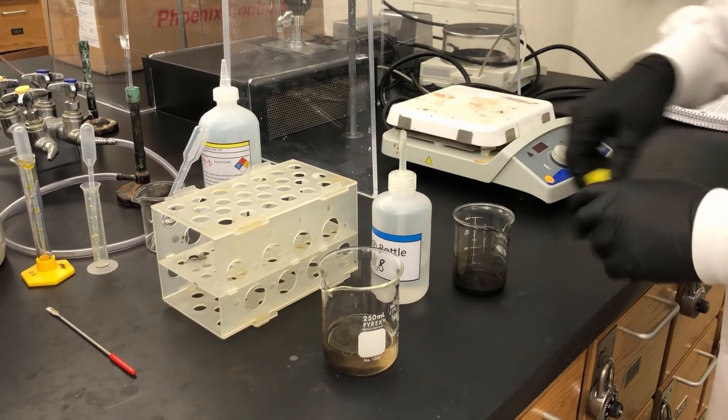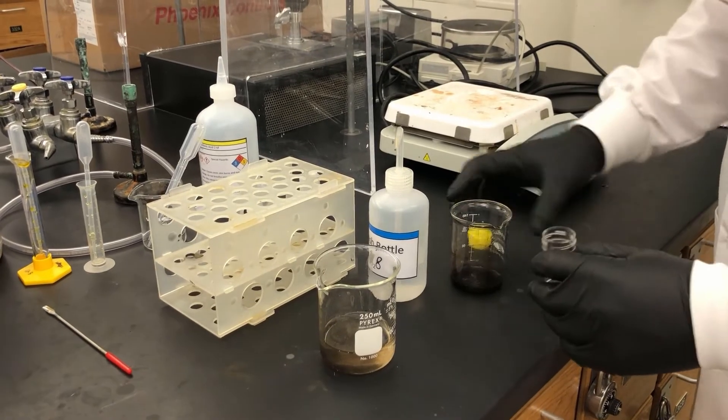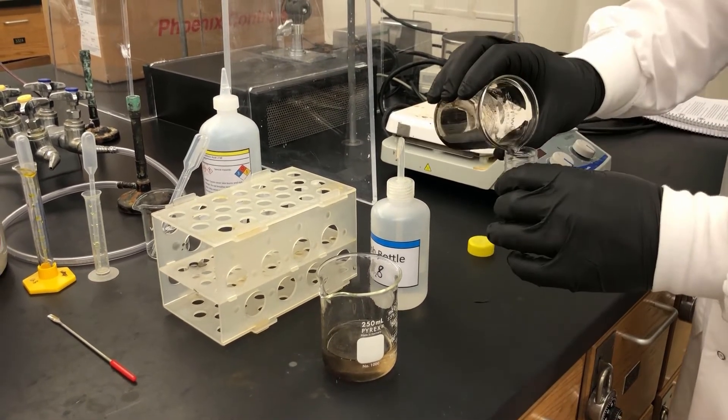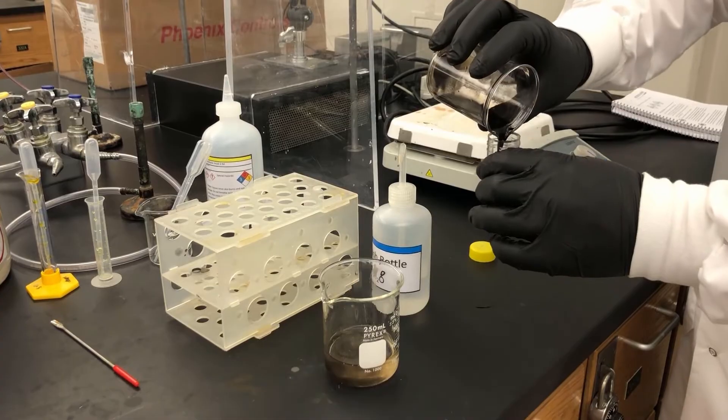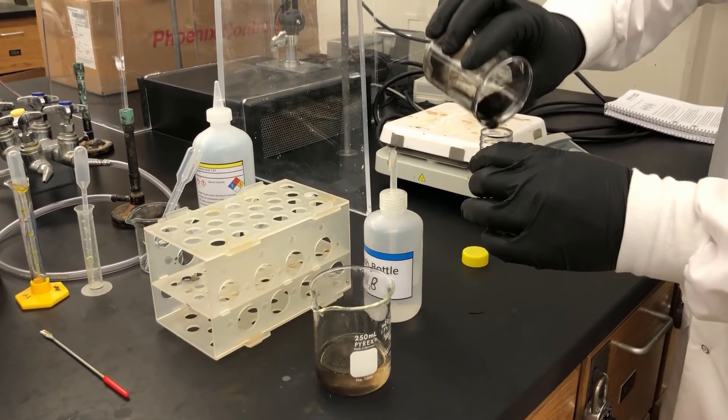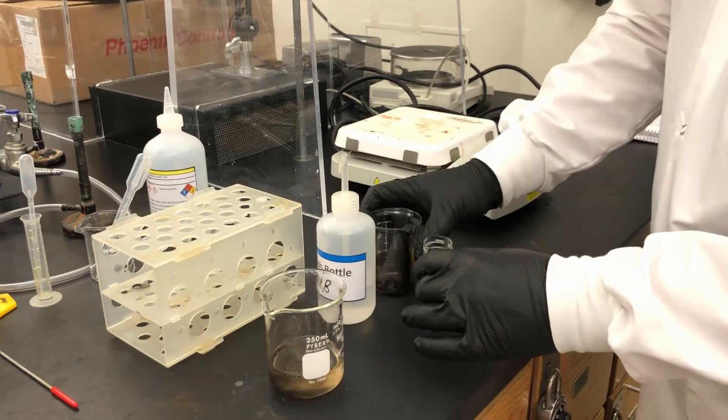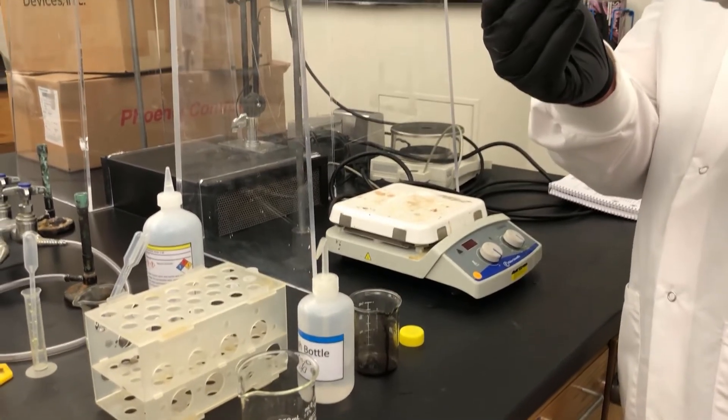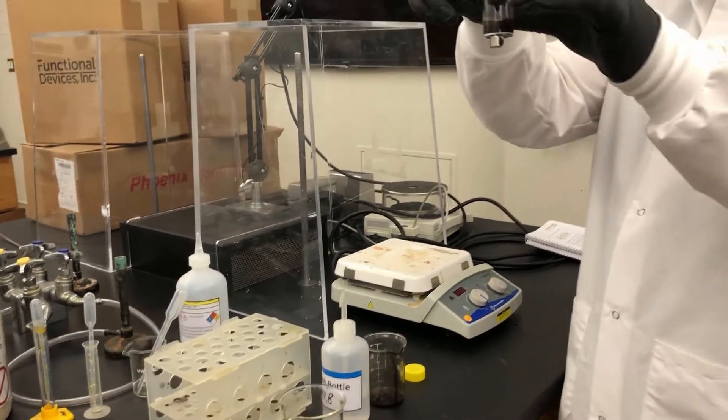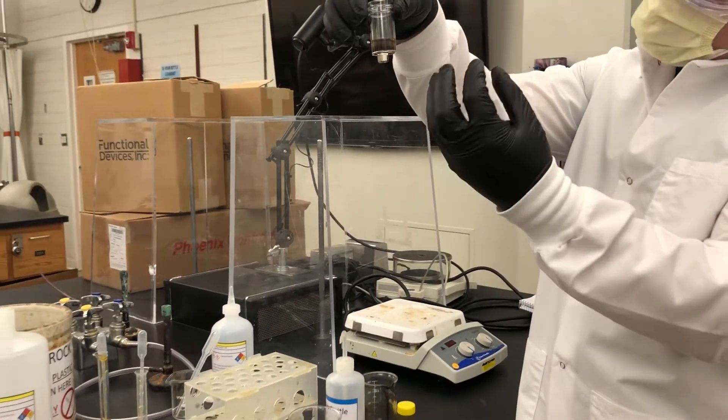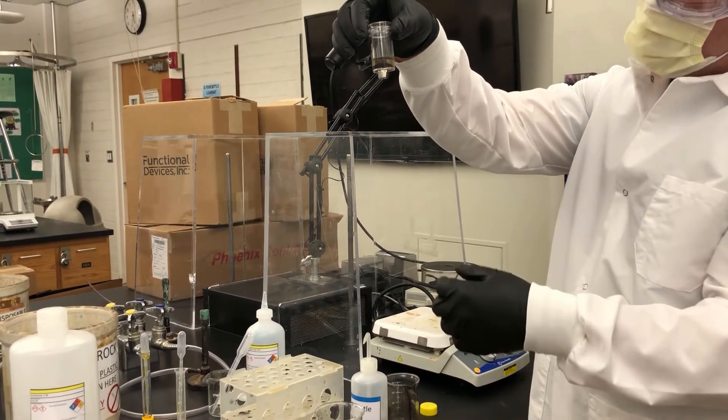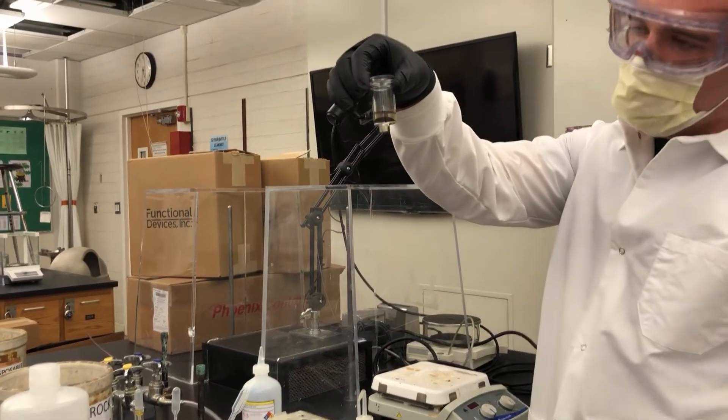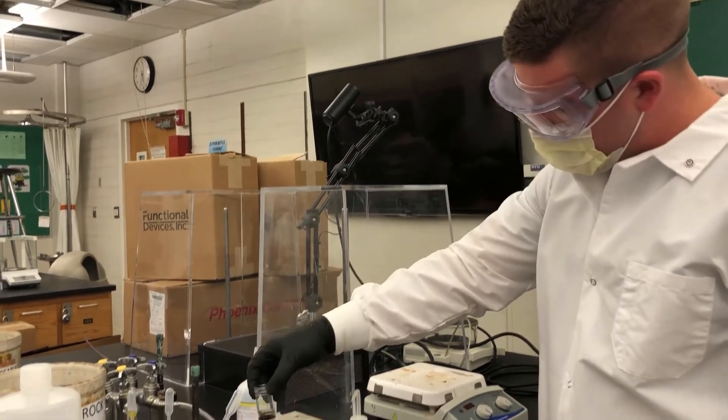I'm going to swirl it. Okay. I'm going to open up this guy. Alright. And what I'm going to do is I'm going to allow the magnet to sit now on the bottom of this yellow container so that any water that I don't want is going to be separated from our nanoparticles. And you can see it's already separating now, which is great.